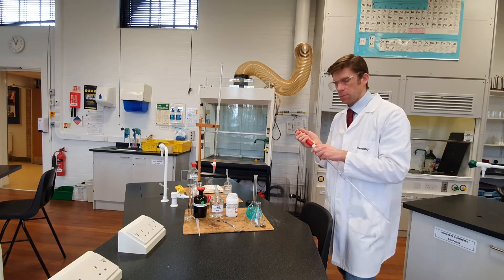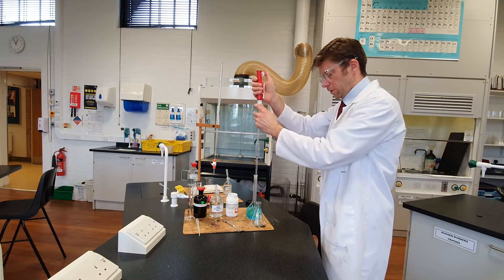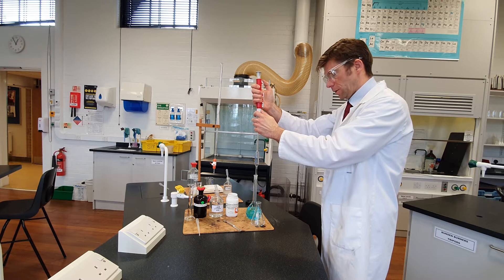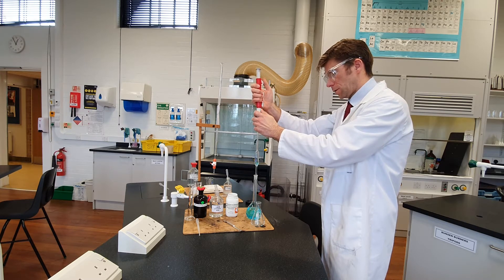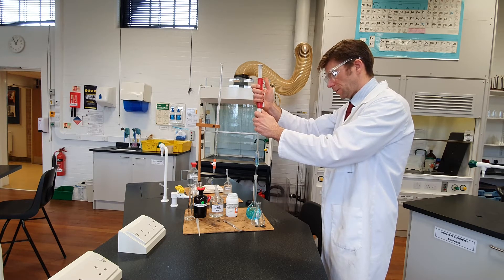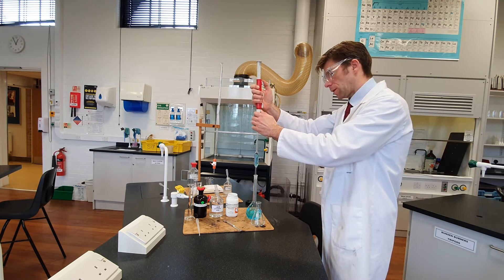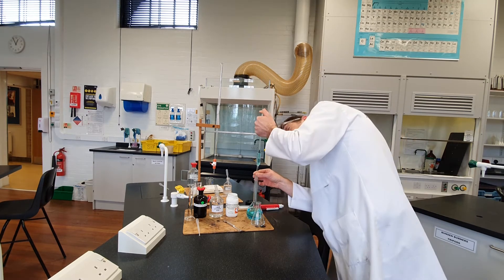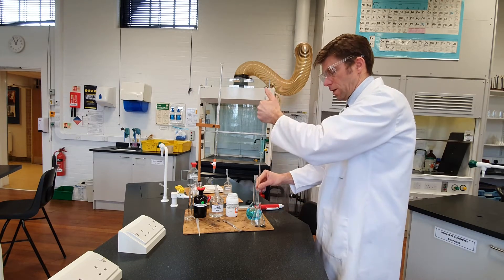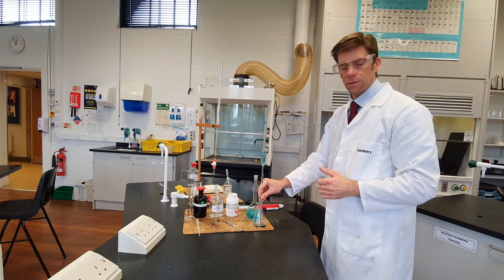Now we need to prepare the sample for the titration. First, we need to take 25 cm³ of the standard solution using a 25 cm³ volumetric pipette. Transfer this to a 100 cm³ conical flask.